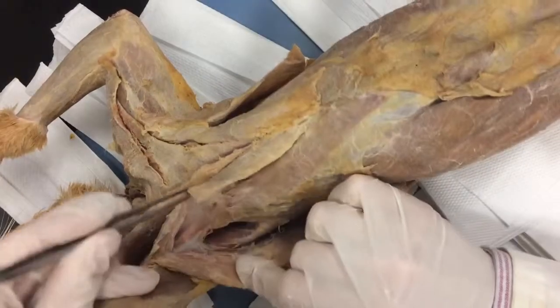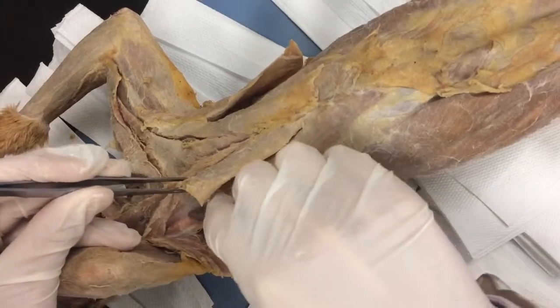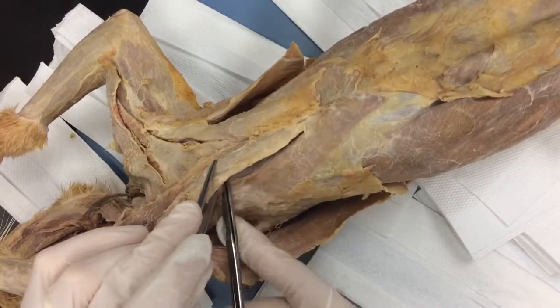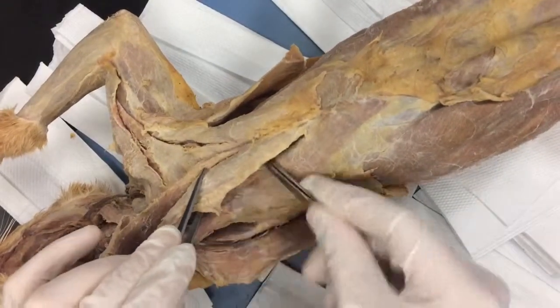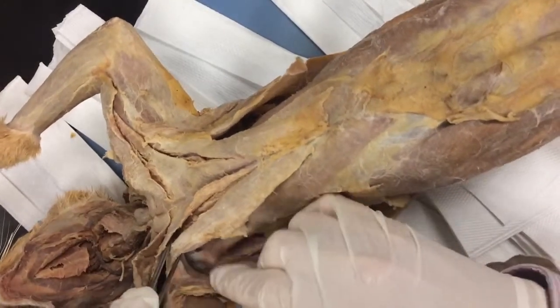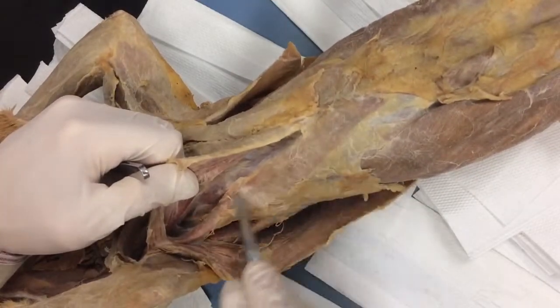Now I'm going to finish minor — I'm going to go right under it. Here's the edge of xiphihumeralis right there; I need to get these two apart. Pull down, pull down. If the fibers get chewy, just put them back together. Pectoralis minor is thick — it's a monster. Take my scissors. I'm all the way to the sternum, all the way underneath it. Push down. No scissor work in here — I don't want the brachial plexus cut. You can see I got that all cleared out.